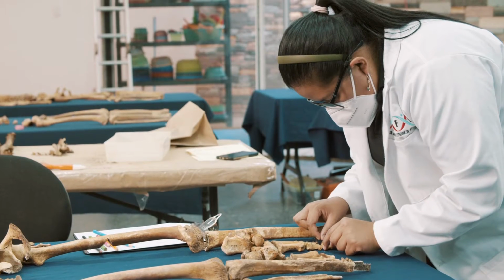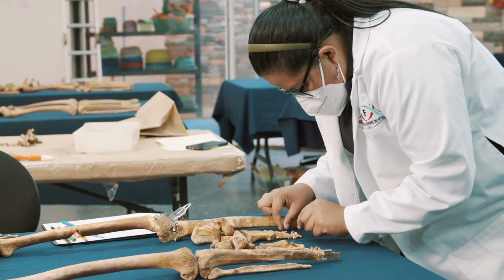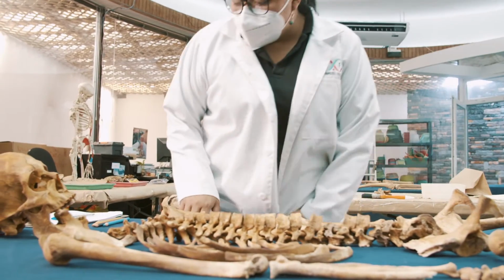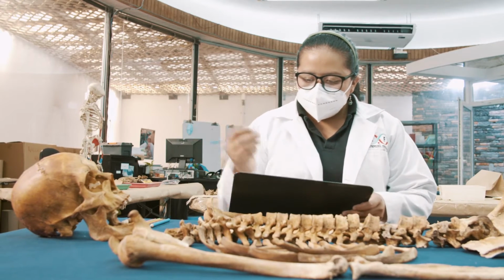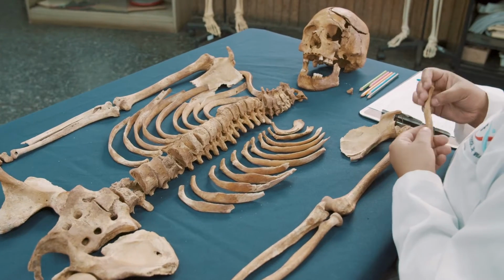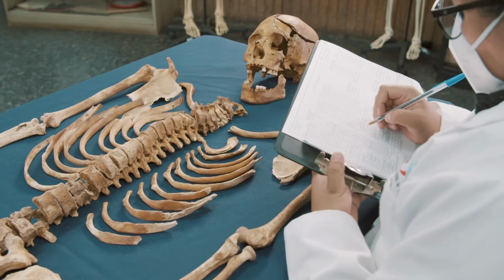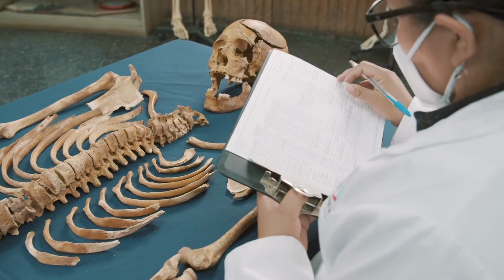Once the bones have been anatomically placed, the condition of the skeletal remains will be established by filling out an inventory, which can be found on the analysis form. This allows us to discover the presence, absence, and state of preservation of the skeletal remains. In parallel to this, any reconstruction of anatomical regions required is carried out. This procedure is important because it helps to create a proper visualization of the damage caused by injuries close to the time of death, circumortem, as well as any postmortem damage.